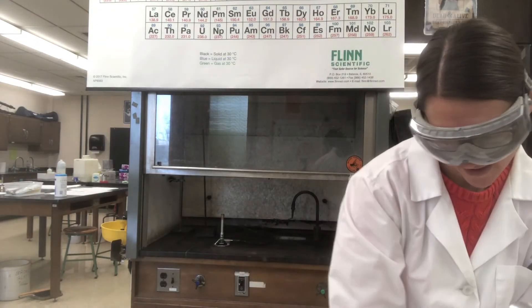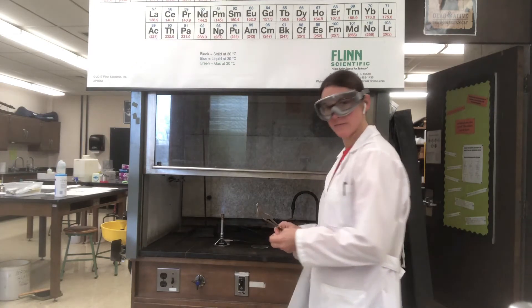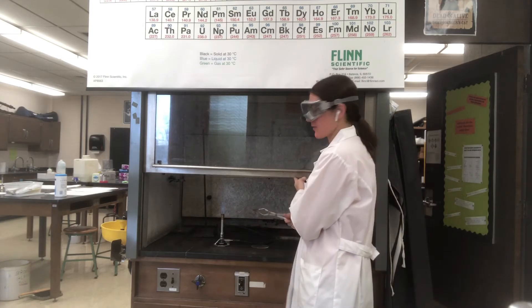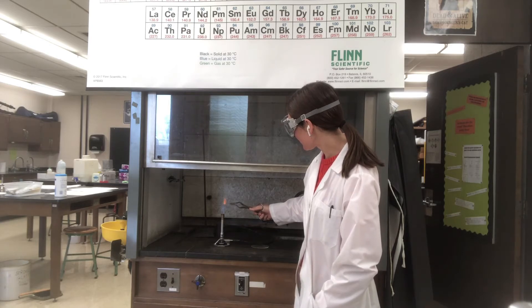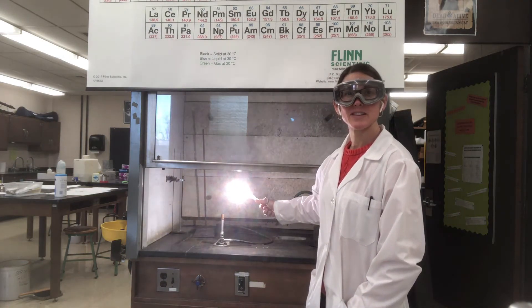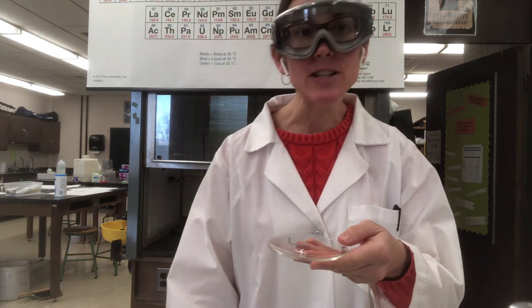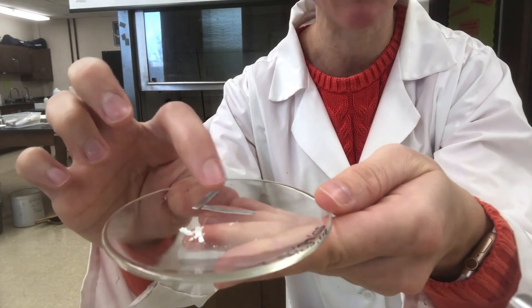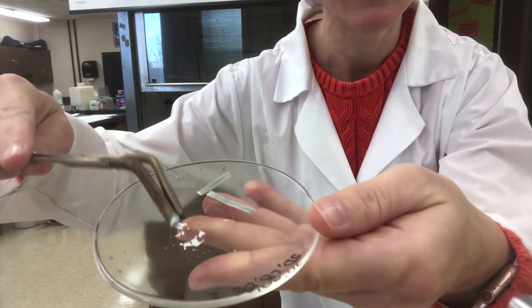Now for the second part of this series, I'm going to take that magnesium ribbon and burn it. First I'm going to light my Bunsen burner, and now I'm going to take this piece of magnesium ribbon and place it in the Bunsen burner flame until it ignites. Make some observations — what just happened? I'm going to bring this close to the camera so you can see what we have when we're done. You can see on my watch glass here I have the magnesium ribbon that started, and then I have some of the product right here.